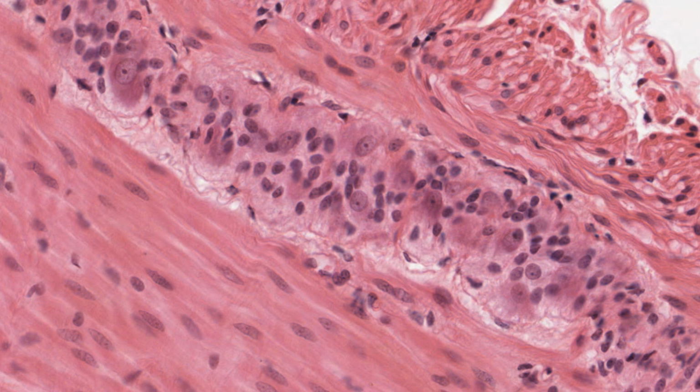Recognize these two external muscle layers of the colon wall. The myenteric ganglia are scattered along the junction between the longitudinal and circular muscle layers. They appear as balls of cells, each with a few large neuron cell bodies showing.